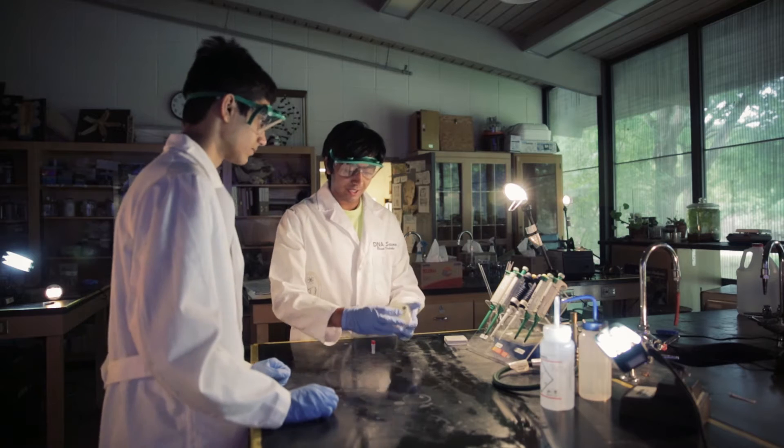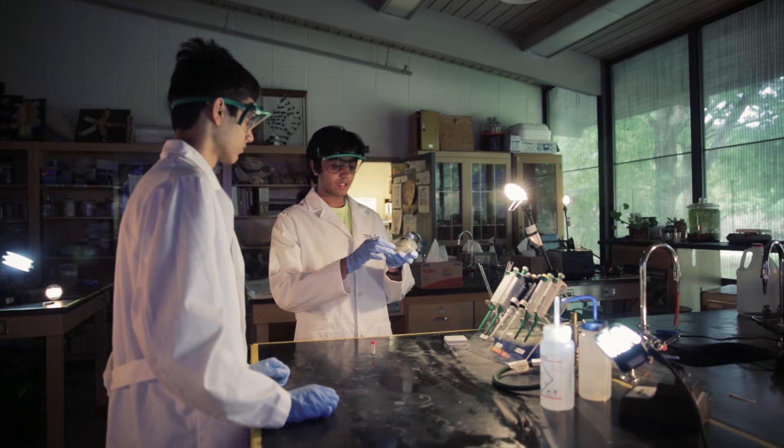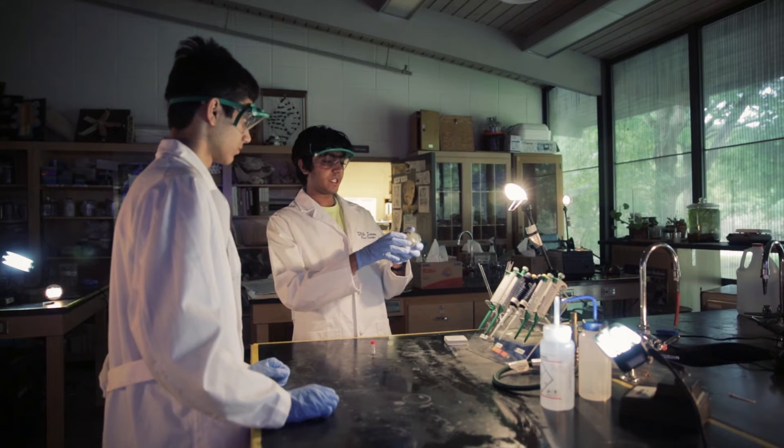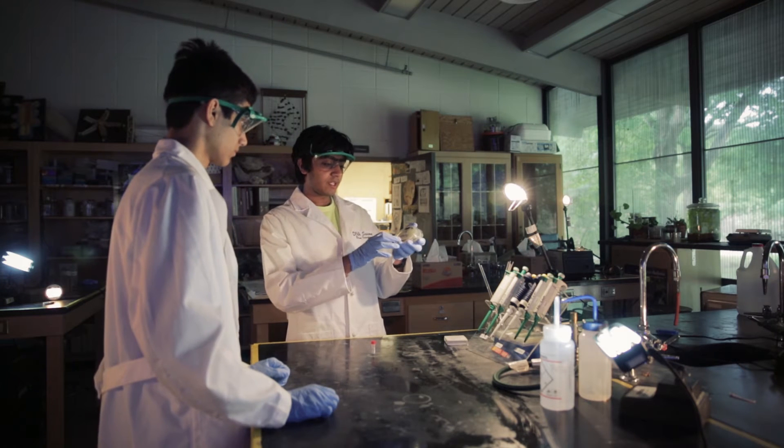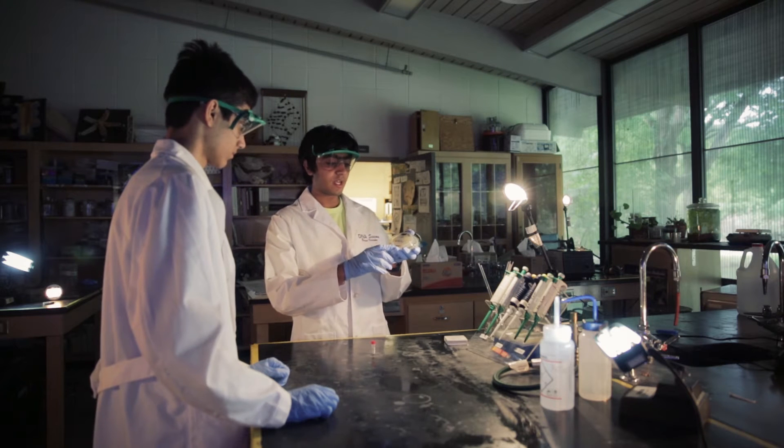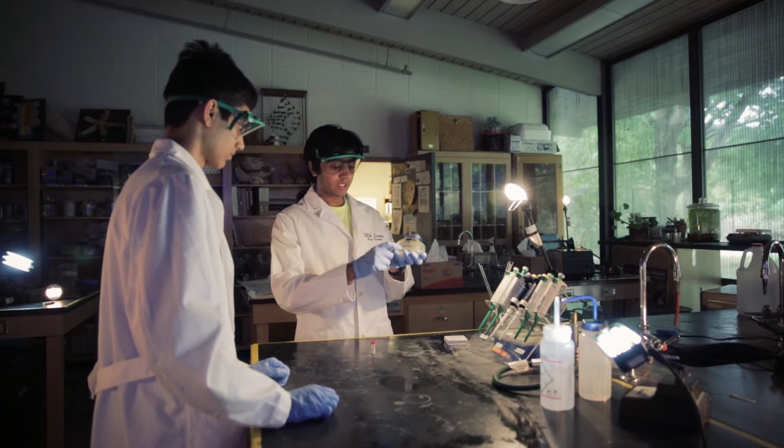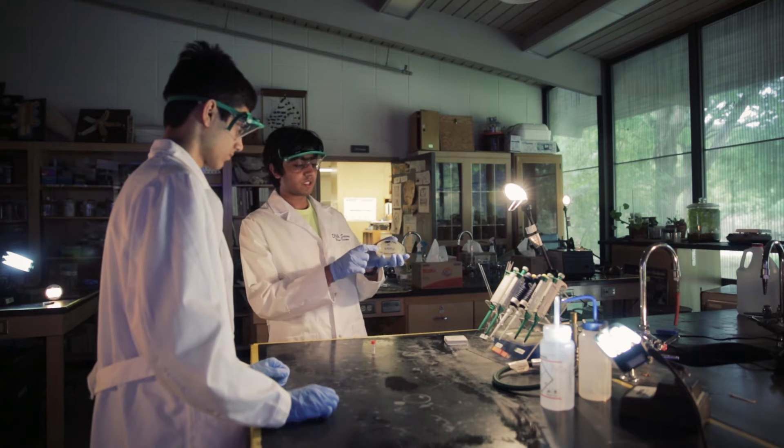These are the plates we have right here and they're labeled. We labeled them on the day we had the agar in them. So that would be April 14th and we mark that they are LB ampicillin and kanamycin resistant. And here we have that they're part A and we're going to do them on June 9th, 2014. So we have the date right here.